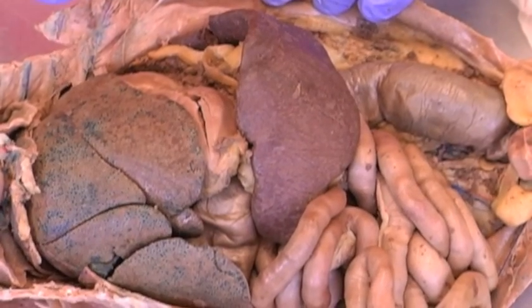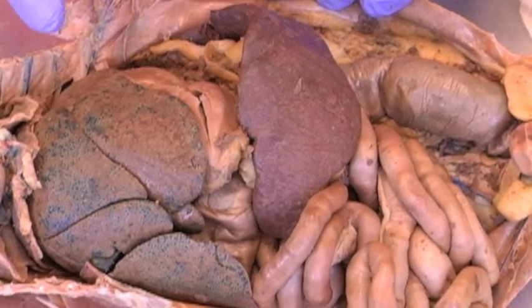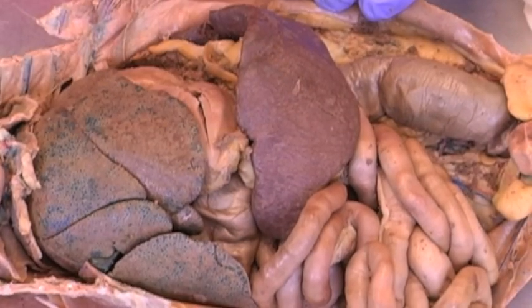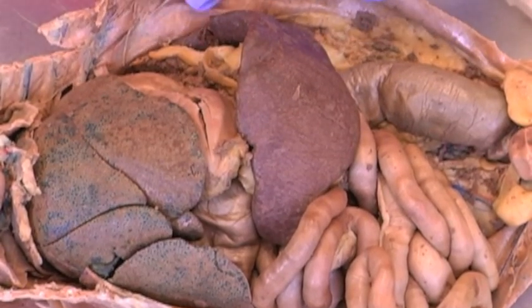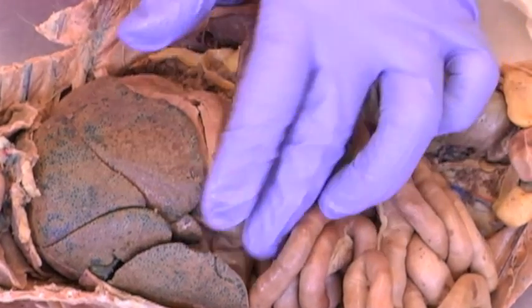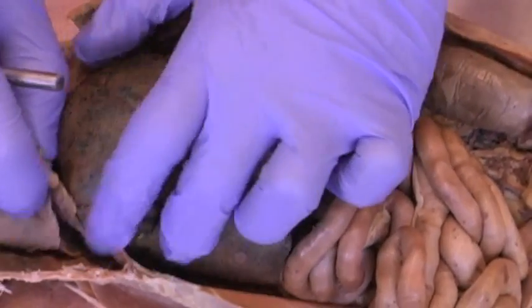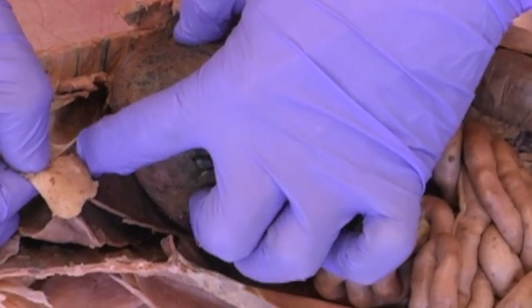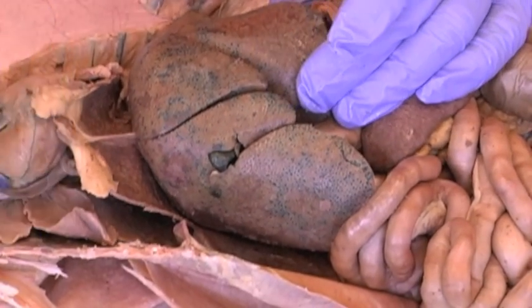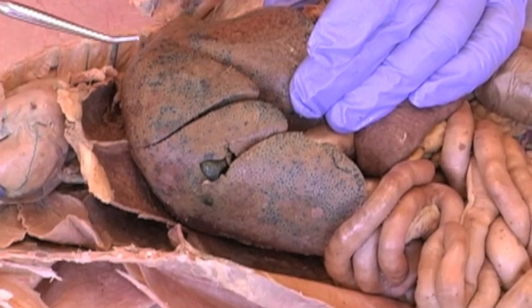In the abdominal cavity, again, the two major membranes covering all the organs in the abdominal cavity are the visceral peritoneal membranes, and on the wall of the abdomen, the parietal peritoneal membrane. Just below the diaphragm, we have the falciform ligament, we can see nicely there, and that divides the liver into the left and right side.